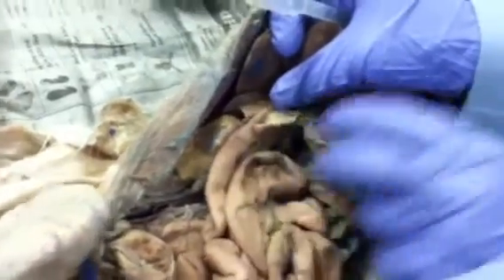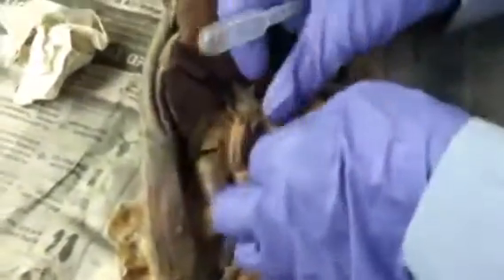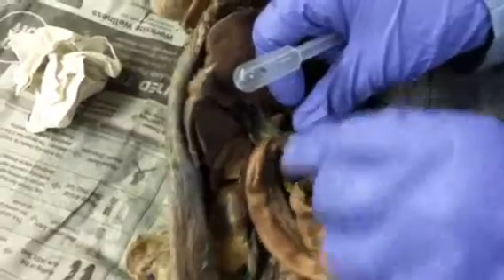And then once you go into the duodenum, that's all villi. See all those little velvety bits? That tissue tells you you've gone from stomach, which is smooth, to villi in the small intestine. This is the pyloric sphincter there. And then you go into the duodenum of the small intestine.